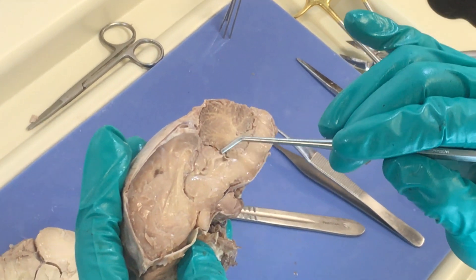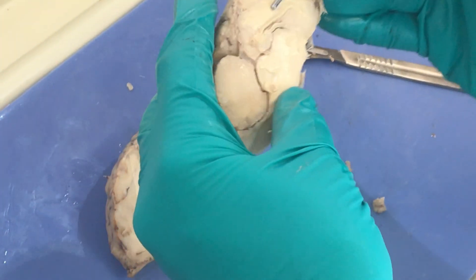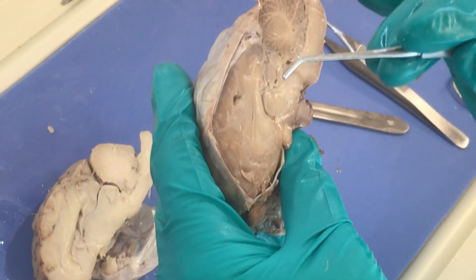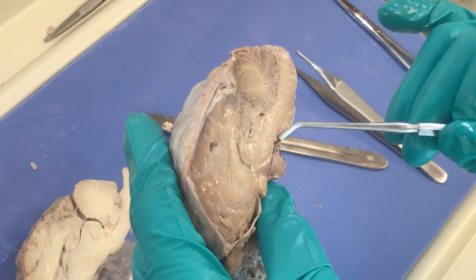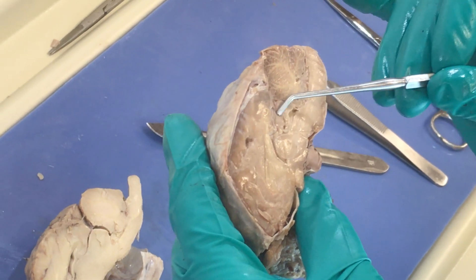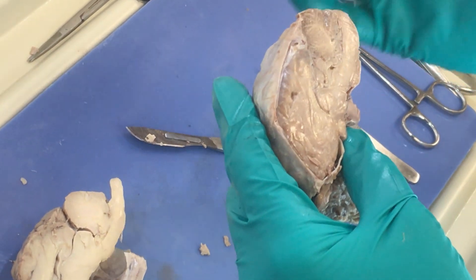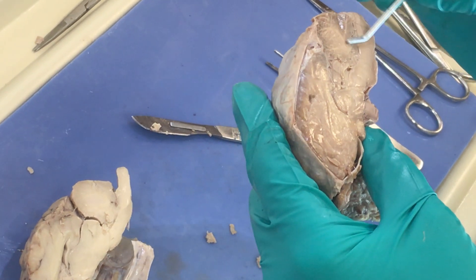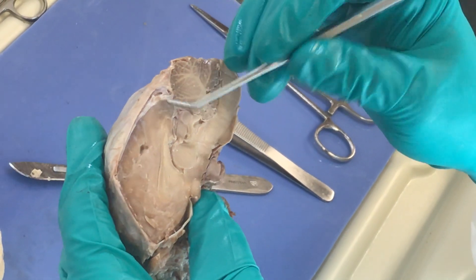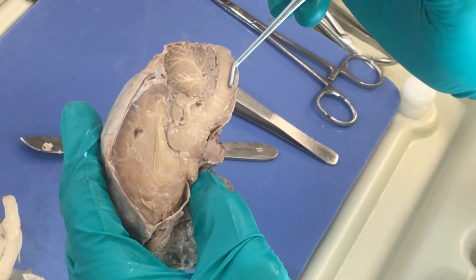This area right here is going to be our midbrain — you can see some swellings there. You start to see this bulge, and as we move further we've got the pons. The pons should be about the level of the cerebellum, which is this structure that sits outside the cerebrum. Remember the cerebellum is for balance, equilibrium, and fine-tuning your motor plans. You can recognize the cerebellum by this tree-like structure called the arbor vitae. The light stuff is the white matter and the outer portion is the gray matter — just like the brain, white matter is internal and gray matter is external. Below that we have the pons, then the medulla, then the spinal cord.